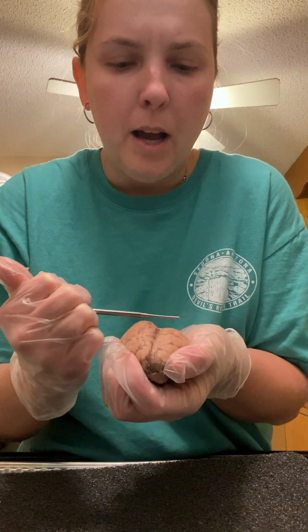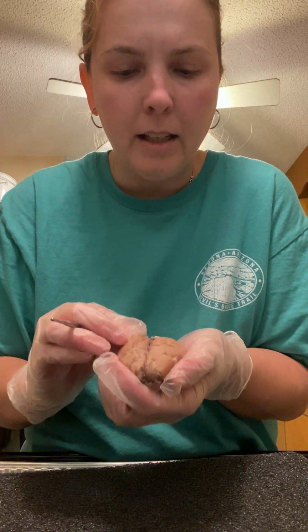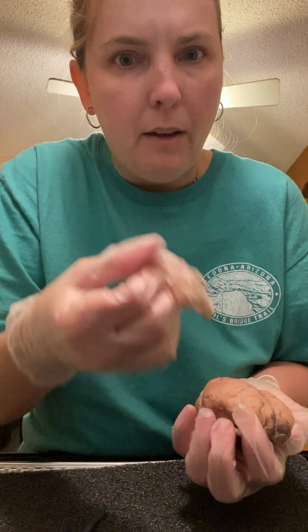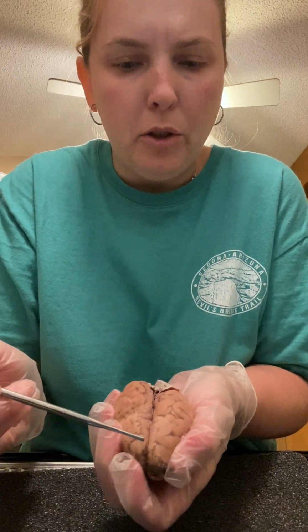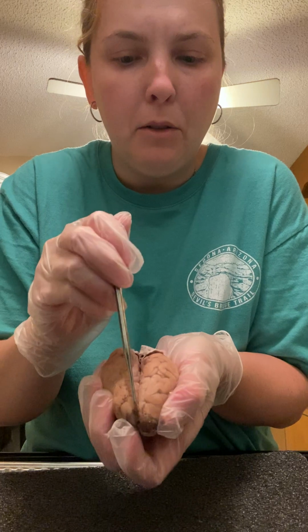And there's also the meninges that cover the brain. The meninges act as like a defense mechanism. They protect the brain against infections, things like that. I have a bit of the meninges left here. I have mostly taken that off, but I do have it here. This is what the meninge looks like, and it covers the brain like that. We have the longitudinal fissure, which is here, separating the two hemispheres of the brain. So that's the long fissure that you have right in the middle of the brain.